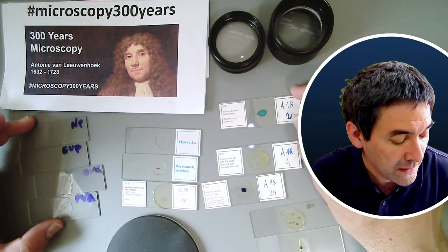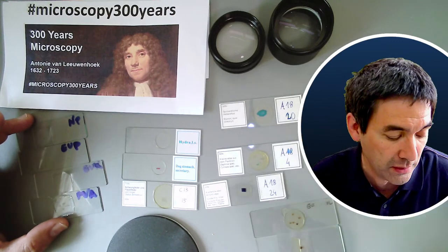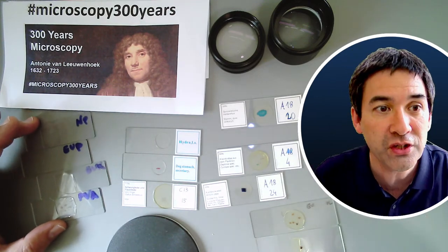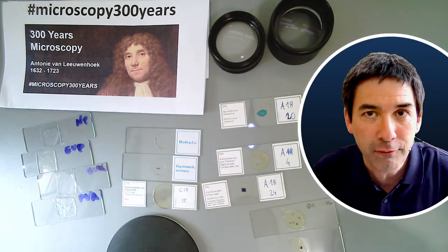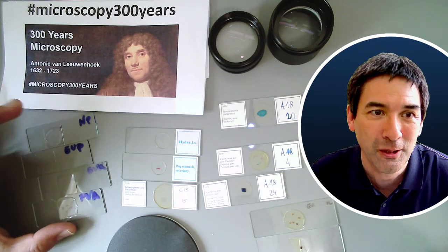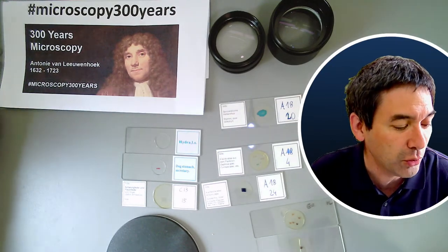I also promised a few weeks ago to put some diatomaceous earth under the microscope — some fossilized diatoms I made into permanent slides. Later on, maybe for about five minutes, I'd like to show them, not under the stereo microscope but under the regular compound microscope, because I promised this. So these are slides I would simply like to add later on.